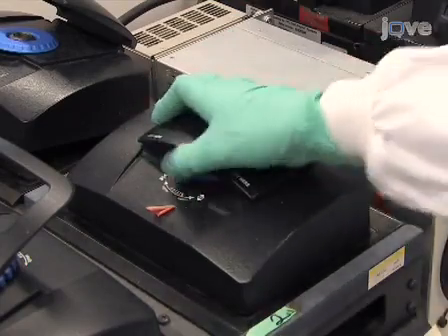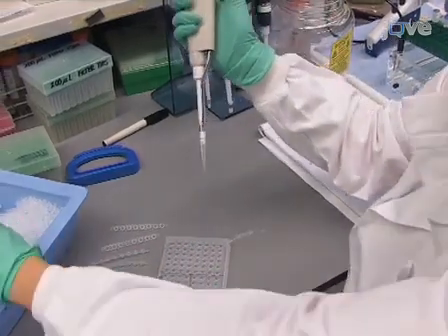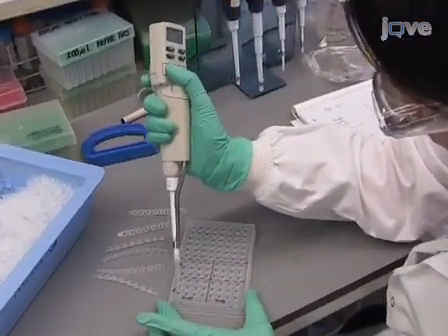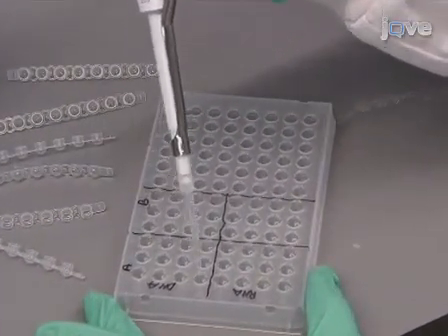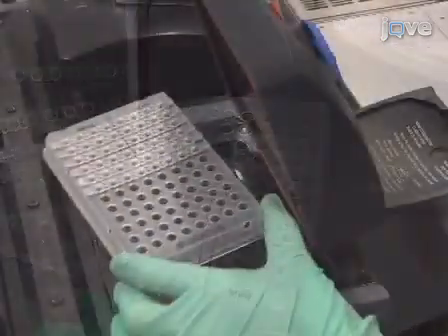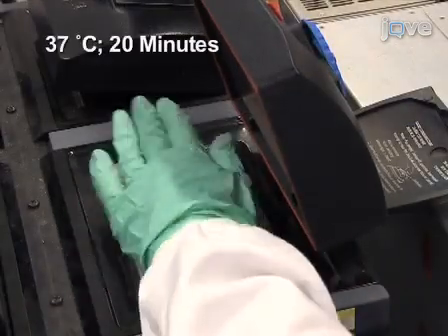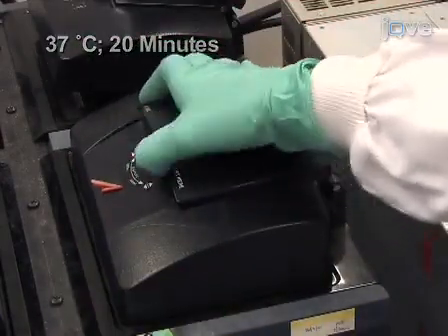Once the PCR reactions are complete, remove PCR primers and excess dNTPs by adding exonuclease 1 and shrimp alkaline phosphatase, SAP, to each PCR product and incubating at 37 degrees Celsius for 20 minutes, followed by 15 minutes at 85 degrees Celsius.